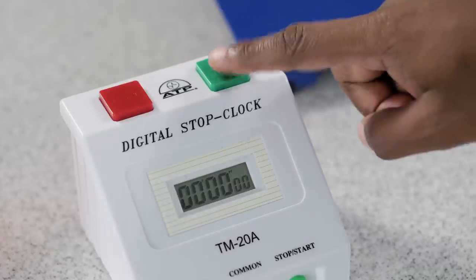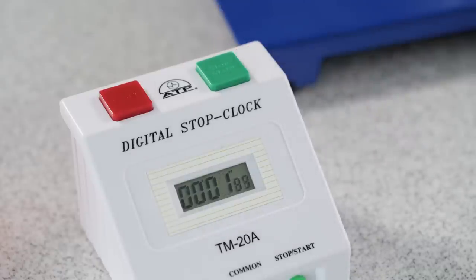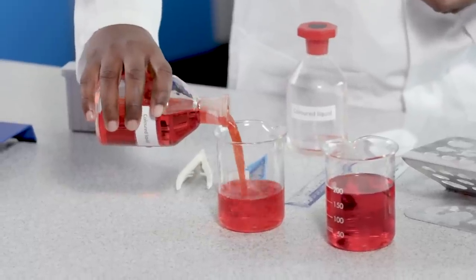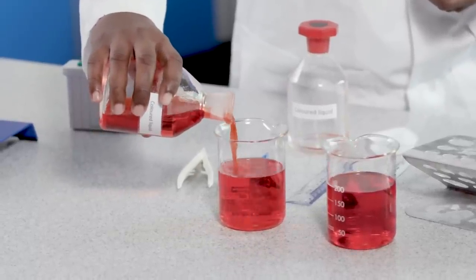Wait for five minutes to let the organisms adjust to the temperature of the water bath. Meanwhile, pour your colored liquid into the beakers.